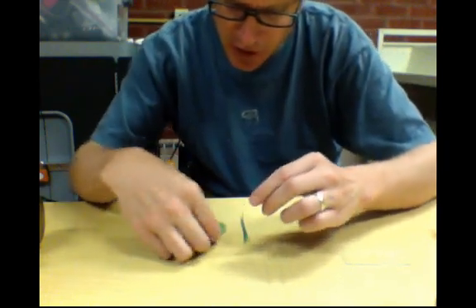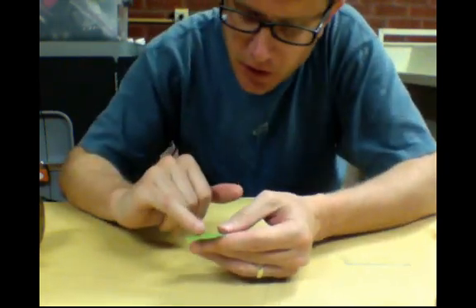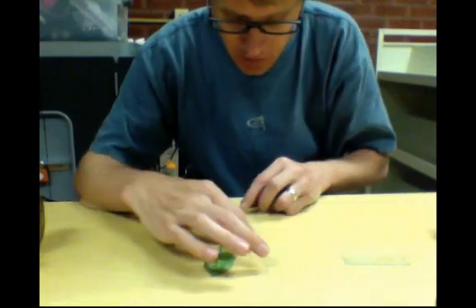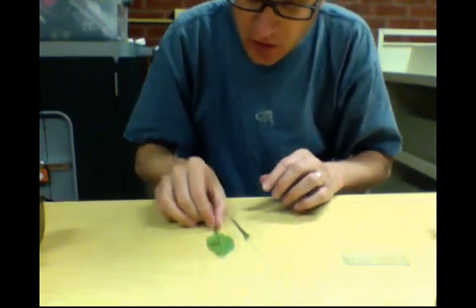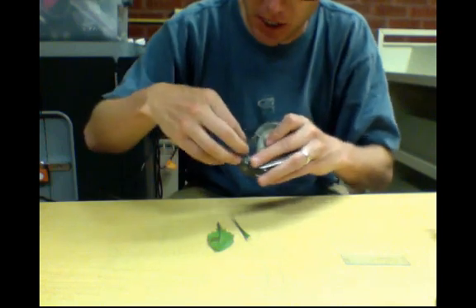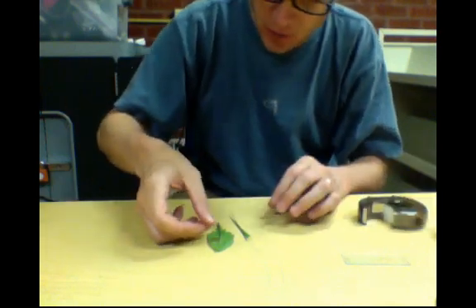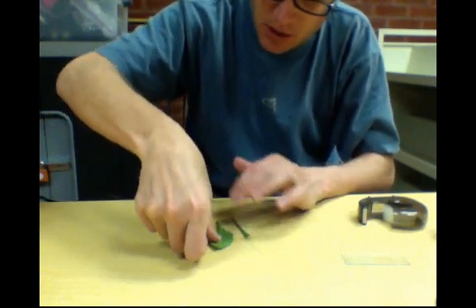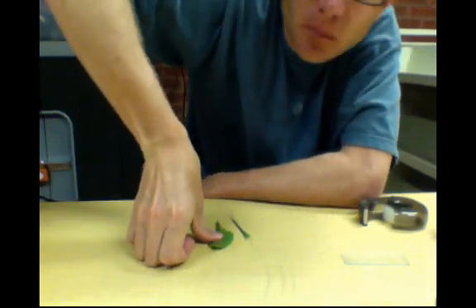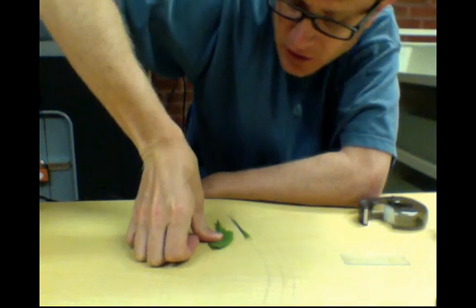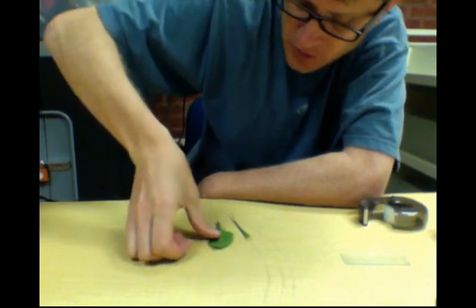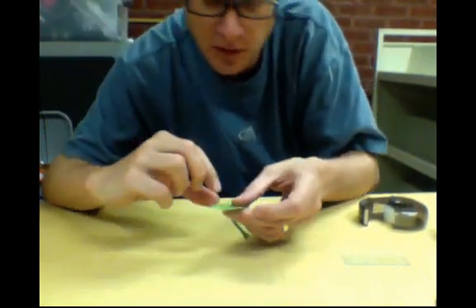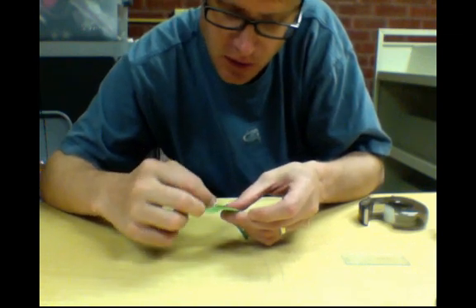Okay. It looks like the leaves are dry now. A good way to tell that is if you just touch on it. If it's not tacky anymore then it should be good to go. Basically what I'm going to do is take a little bit of tape. I'm then going to put it on the section where I've painted. And then you're going to push down. You have to apply a little bit of pressure on it. You want to make sure that you've covered every place of the leaf.